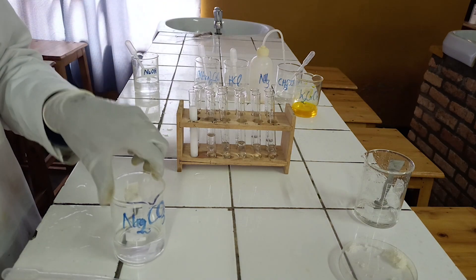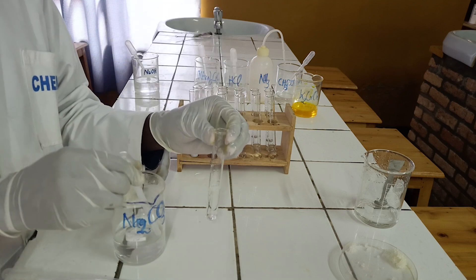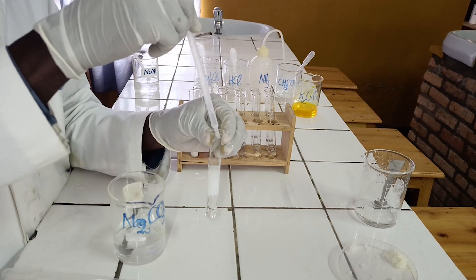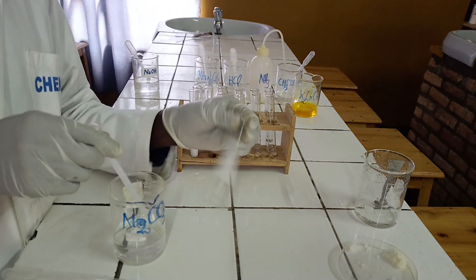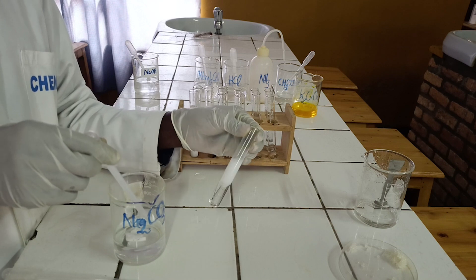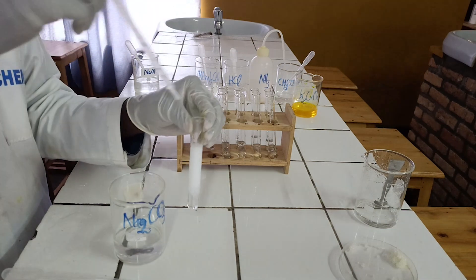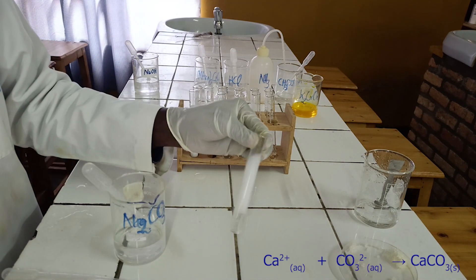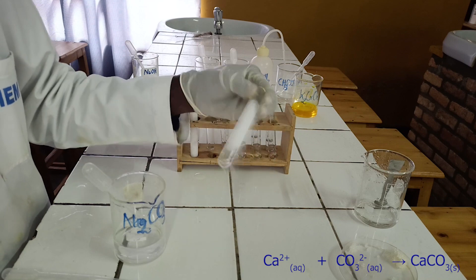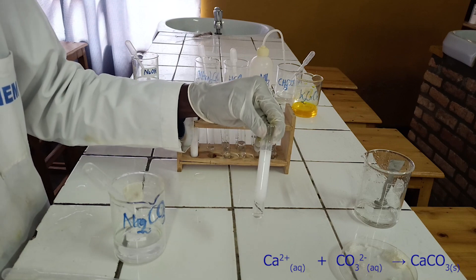To the second test tube, add sodium carbonate solution dropwise until in excess. Sodium carbonate reacts with calcium ion to form a white precipitate insoluble in excess sodium carbonate. Below, there is an ionic equation for this reaction.